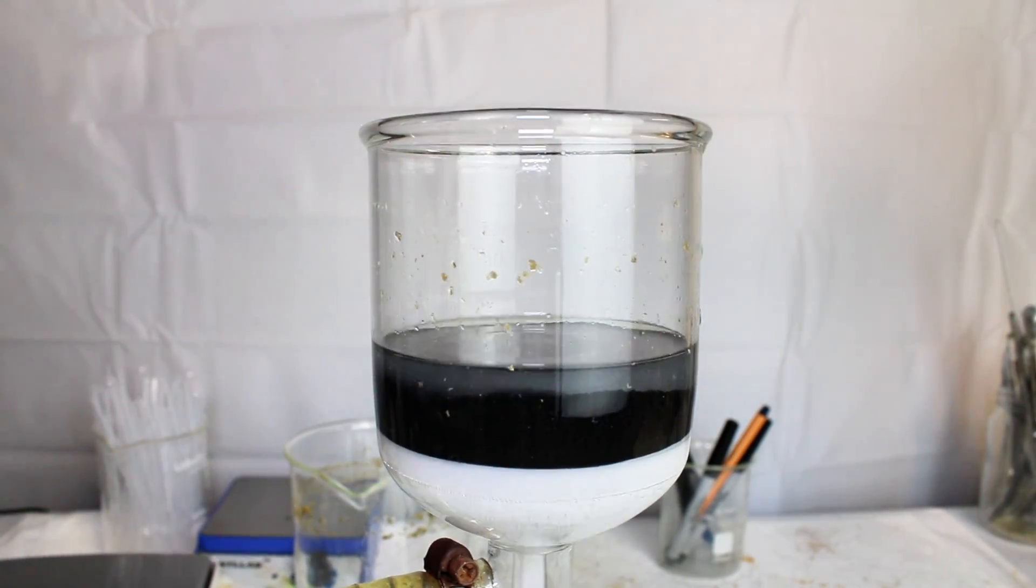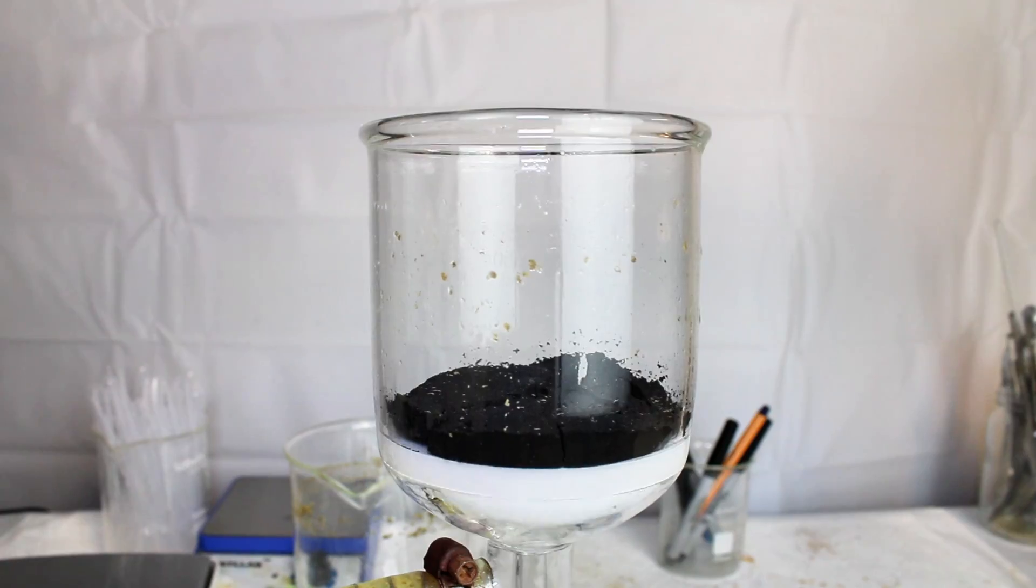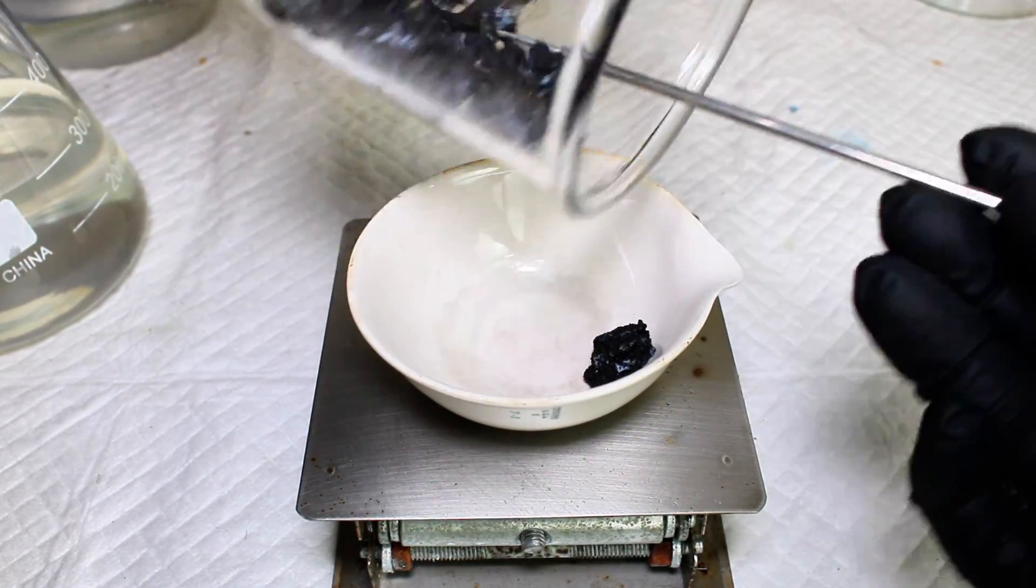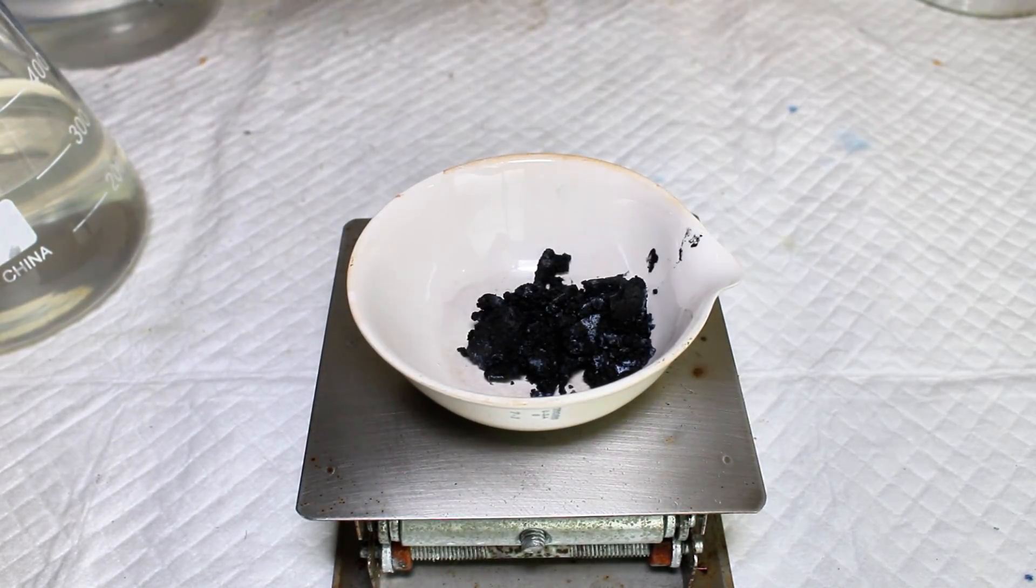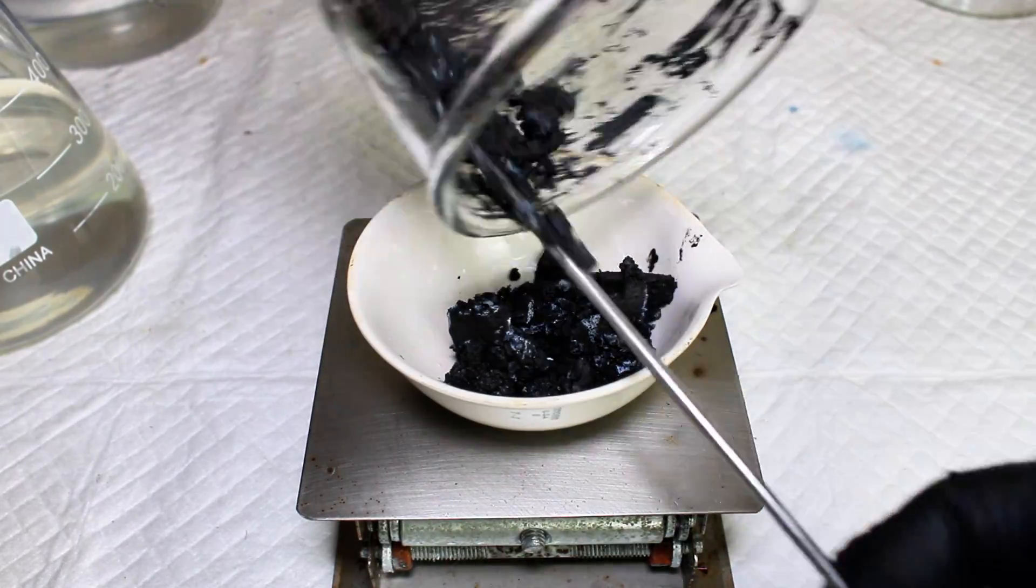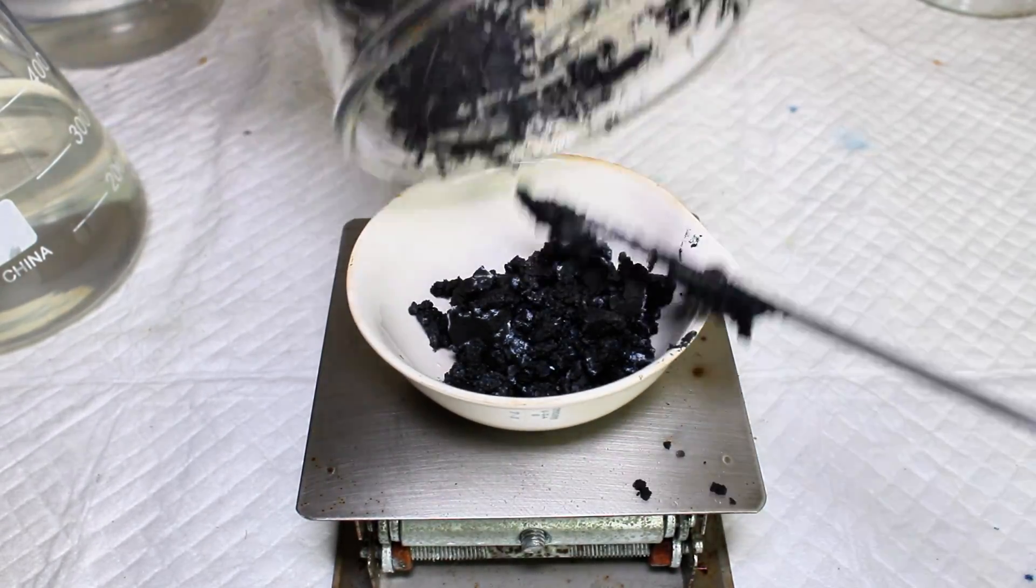I weighed my dry bismuth powder, and I got a final mass of 11.4 grams, which represents a 94% yield. This is pretty good, and honestly, if you just need bismuth metal, I would recommend stopping here.